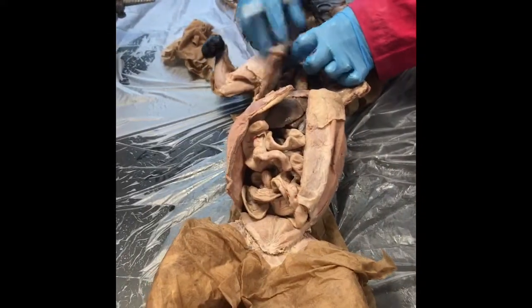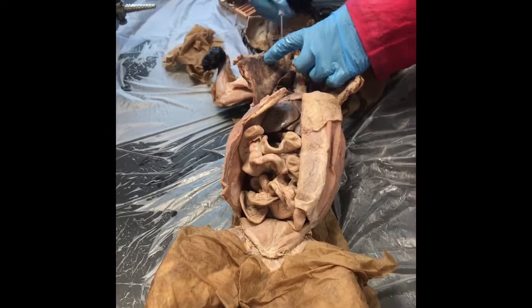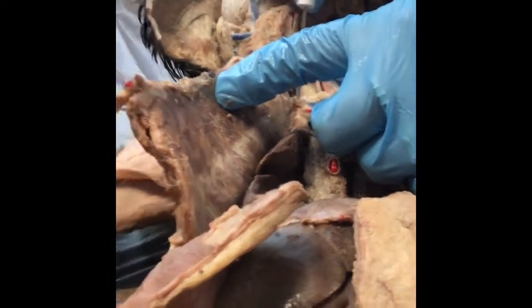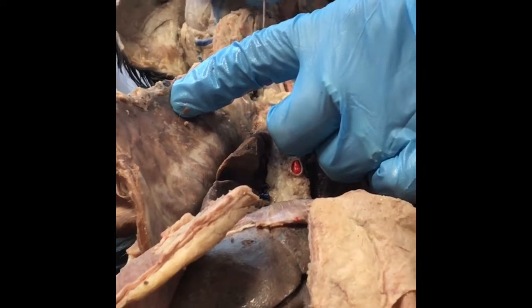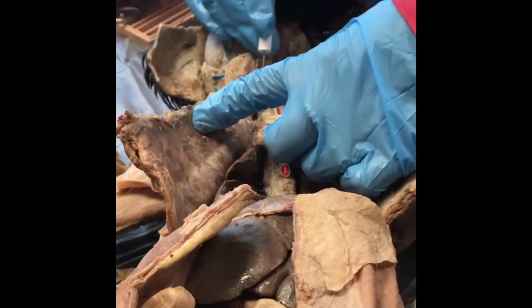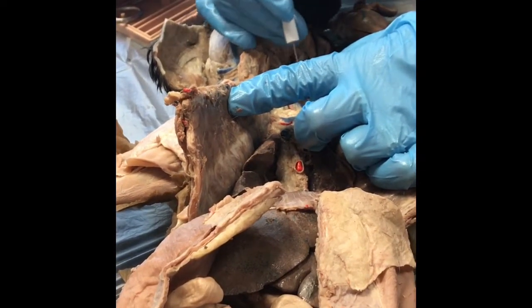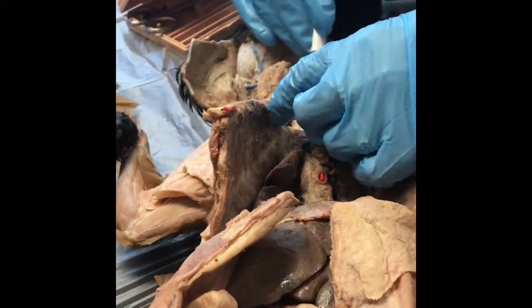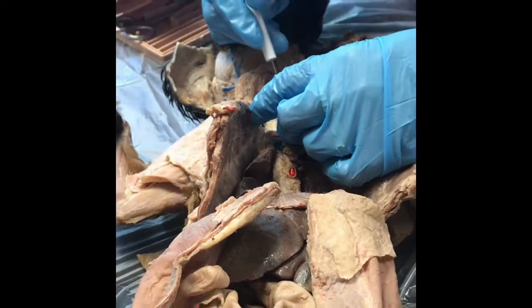Can we see now what's going on? Here's what's happening. This is going to be the end of the superior vena cava, and then as you branch off, do you see that? That's what we would call the brachiocephalic or the innominate right there. And again, it's blue, it's going to be a vein, right? And that's going to be until you branch off, and it kind of tore, but again, the innominate's not very big. It's like the two stems of a Y.